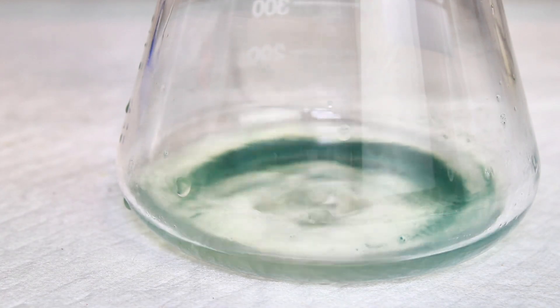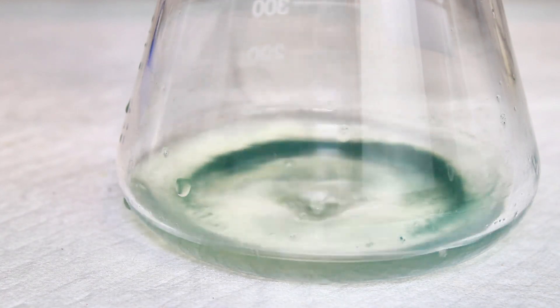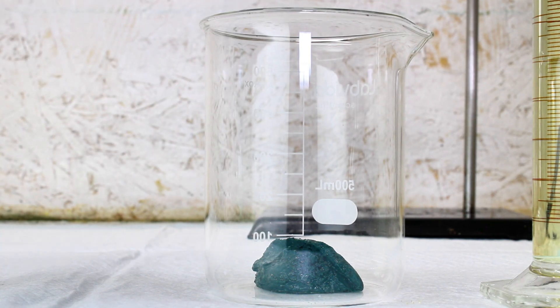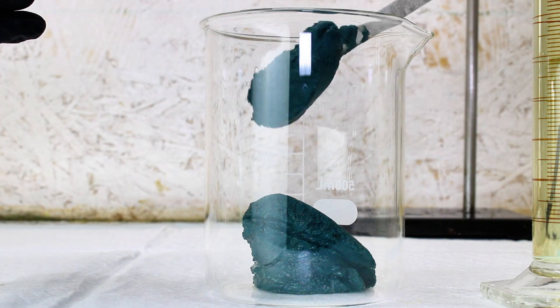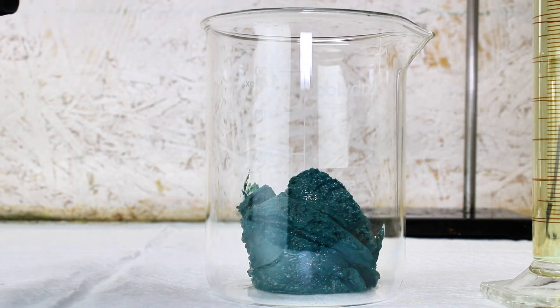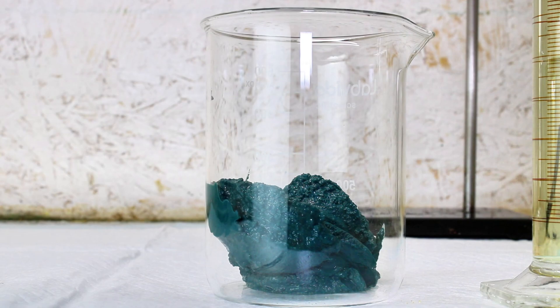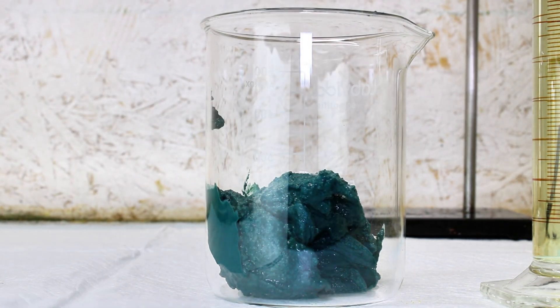And chromium chloride, in its hydrated green state, is nearly virtually impossible to crystallize in my own personal experience. That said, it's likely better if the chromium hydroxide is dry at this state, but given how hard it is to dry, I just don't even bother.